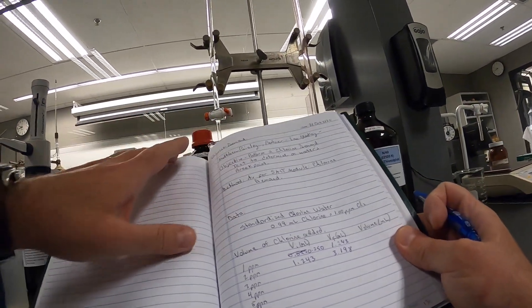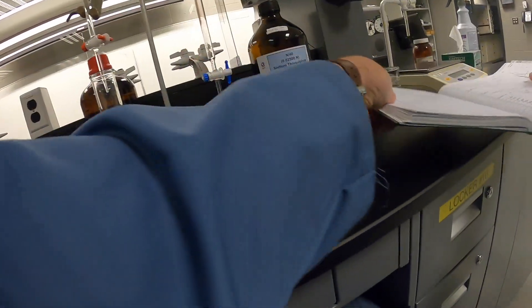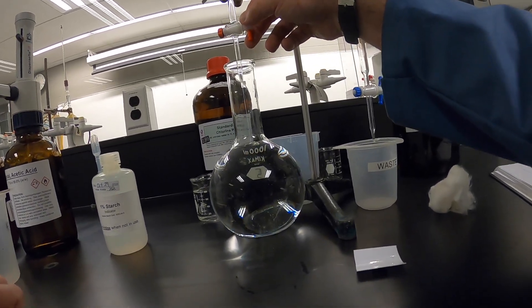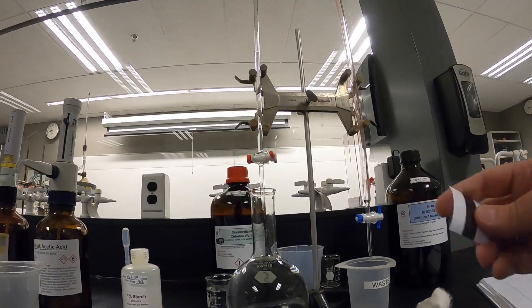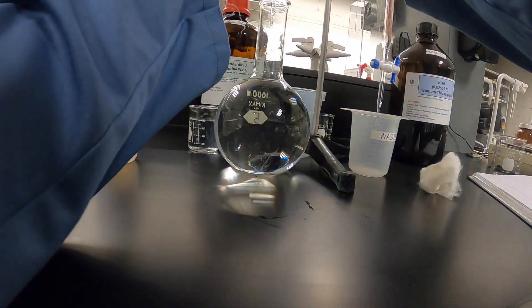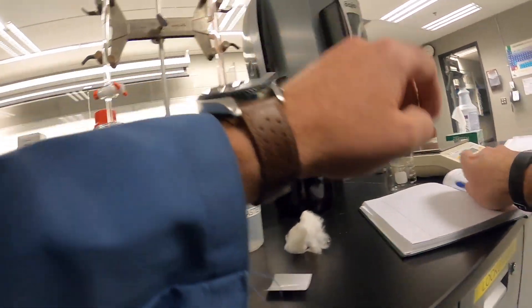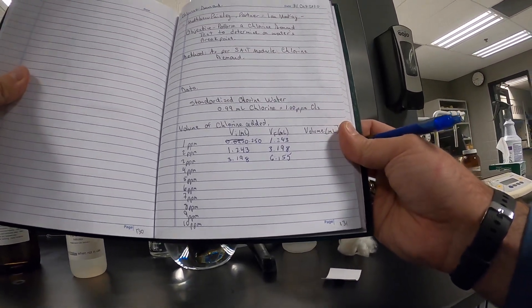Third one. This volume is 6.155 mL — that's the third dosing.